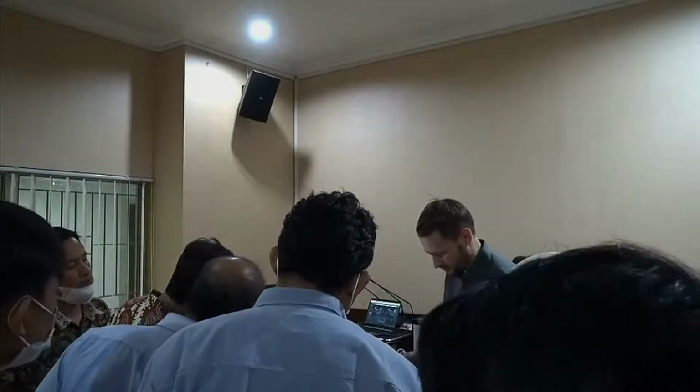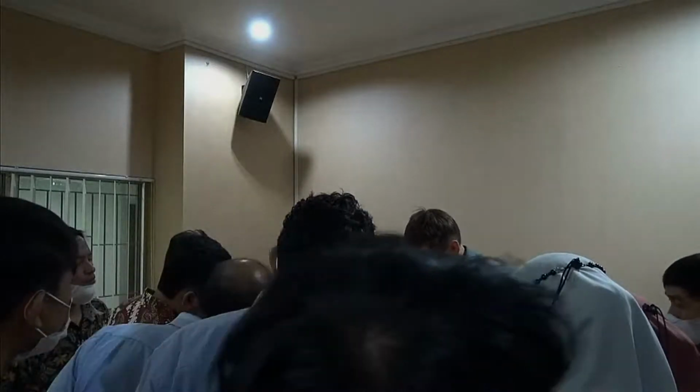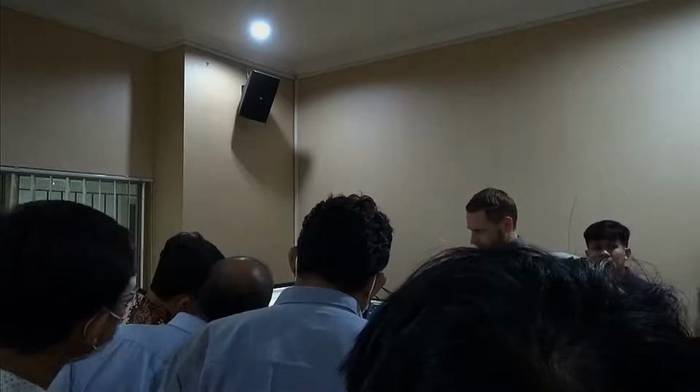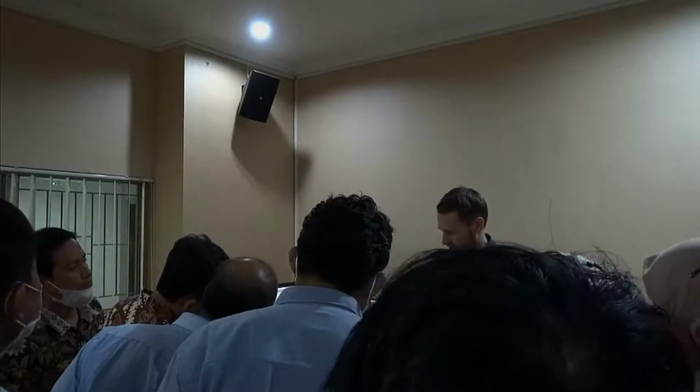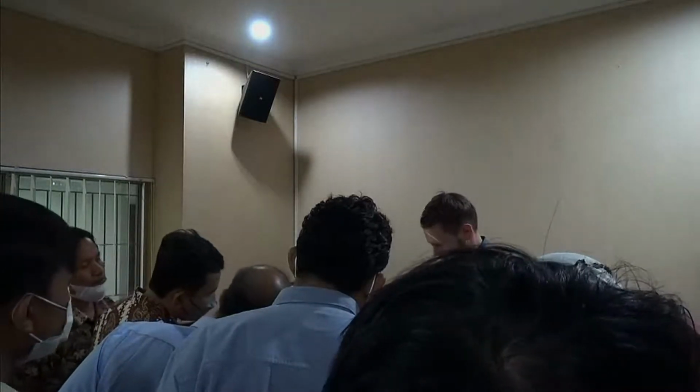Here you see the beam obscuration. So this is what we want to be, I mentioned, anywhere between 10 and 20 or 10 and 25. So if you don't know about your sample, you always go careful first, and when you see it's not enough, you just add a little more. So now we wait again, and we see, okay, it's slowly rising. Maybe we add a little more. This should be enough now. So as soon as we reach 10, we can actually stop adding more sample. Maybe still a little more. It already starts.